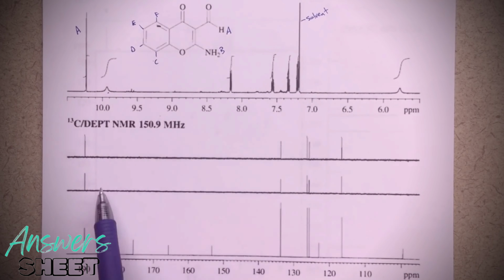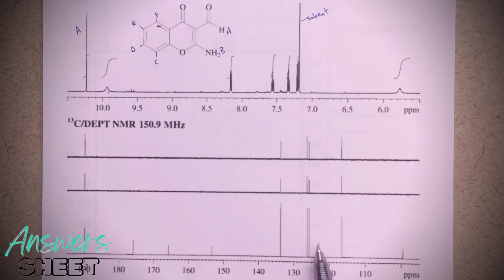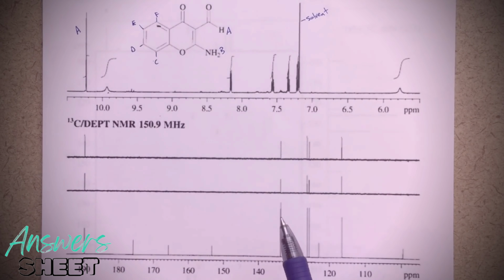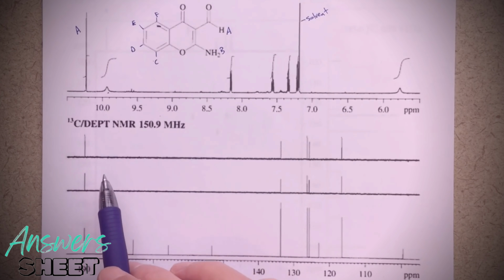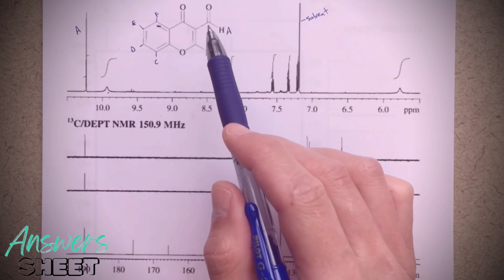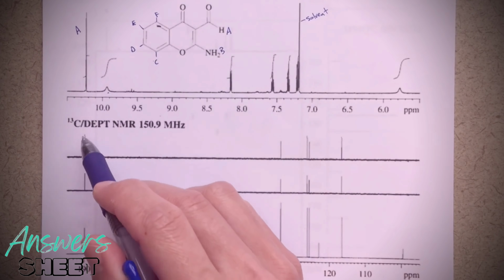So these 2 experiments here are showing us which carbon, so this is my carbon spectrum, right? I've got 1, 2, 3, 4, 5, 6, 7, 8, 9, 10 different carbon signals for my 10 different carbons in my structure. And the signals at like 117, 125, 126, all of these signals, since it's the DEPT experiment, are telling me that these are the carbons that have actual protons bonded to them. So this carbon here that has this aldehyde proton, I already know that that's going to be this one here.